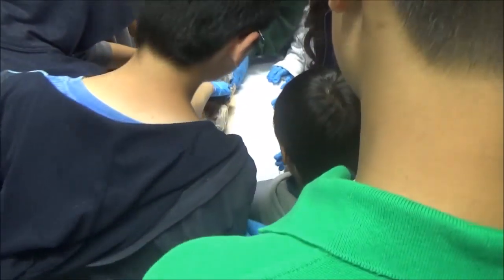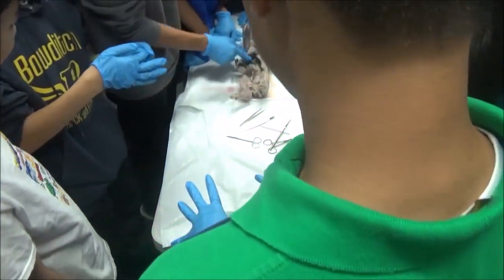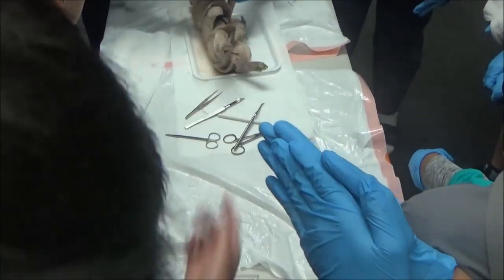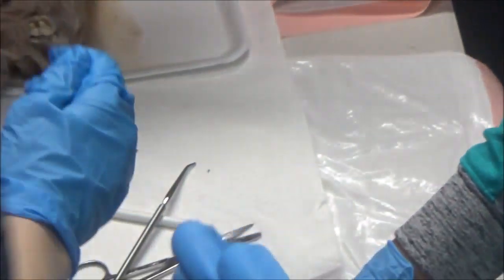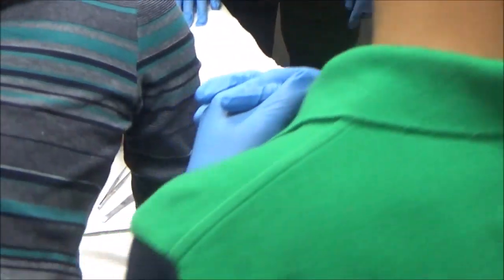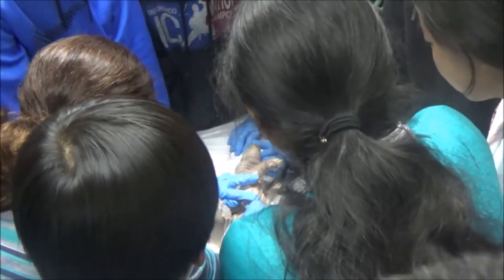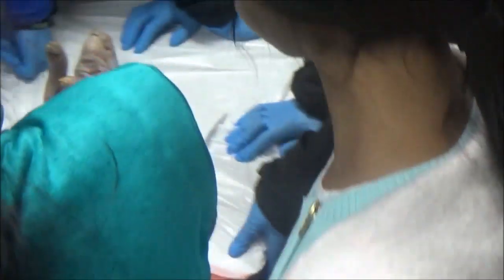I already took one home from the rack. So we have the liver, and under the liver we have the gallbladder, and we are seeing a weird hangy-roundy kind of thing. Do we get to see the brain? Eventually. That's the pancreas. What do we think this is? Stomach. Very good. And this thing that's kind of wrapped around the stomach? Stomach tissue? This is actually the spleen. The spleen has nothing to do with digestion — it just hangs out next to the stomach.